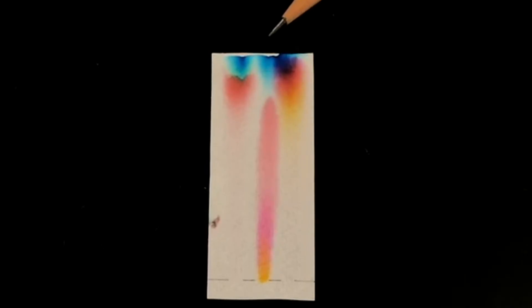Look at the finished product. Remember that these three black markers all looked nearly identical. Now we can see that they actually each have a different chemical profile. In a laboratory, we can use the chemical profile that's found in each of these inks after separating them out to figure out which pen, printer ink, marker, or other type of ink would have made a mark on a piece of paper.